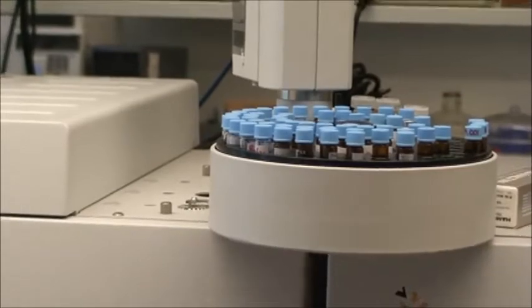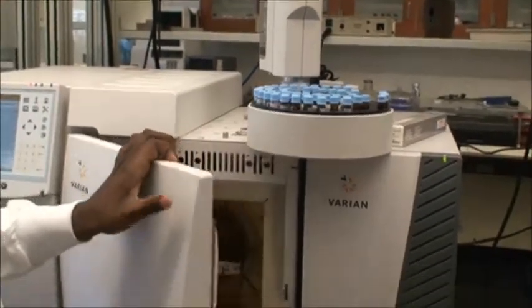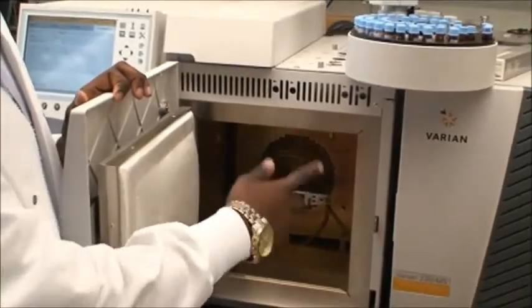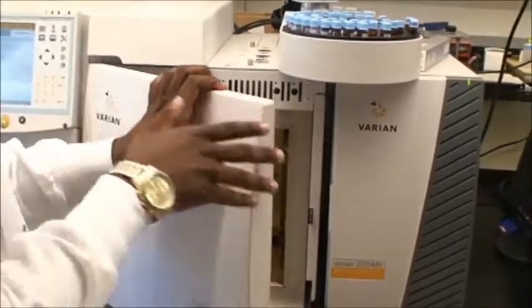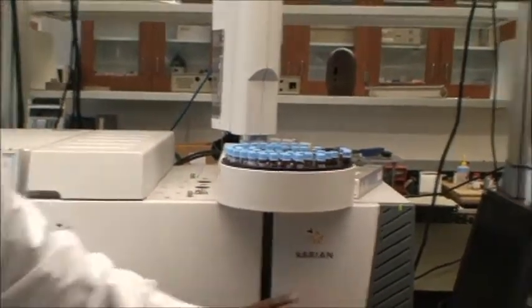The long column that we see in the oven here goes round and round, and then it's pushed through the mass spec, which is located on this side.